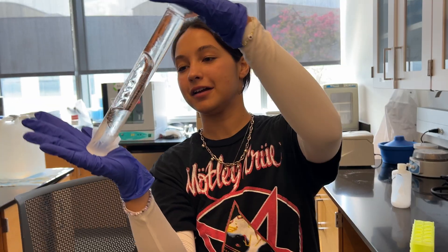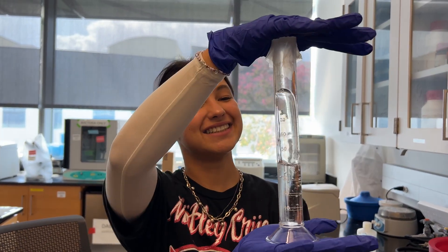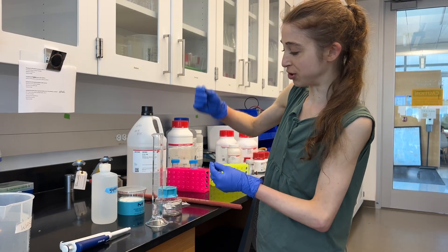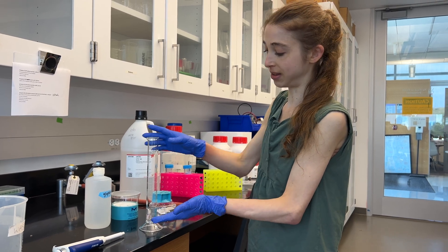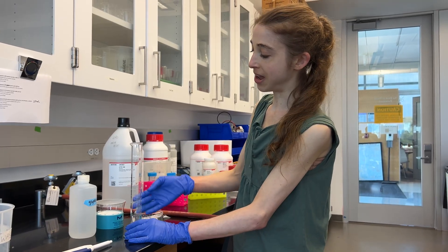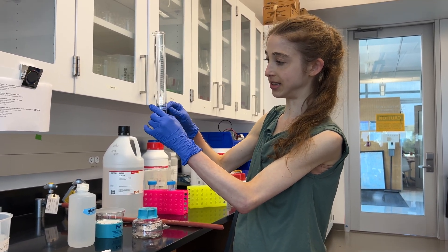It's really fun to make. Instead of trying to measure out glycerol with serological pipettes or something, I just go ahead and use a graduated cylinder, but I add water before I add the glycerol. That way I don't get the glycerol sticking to the graduated cylinder.